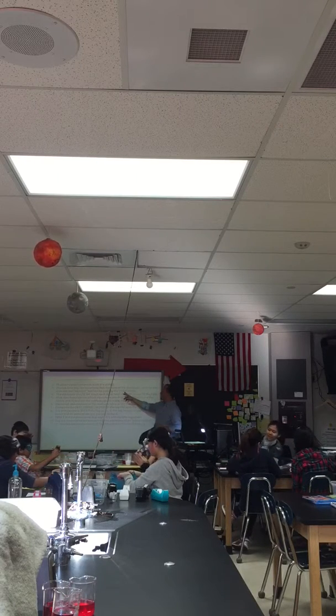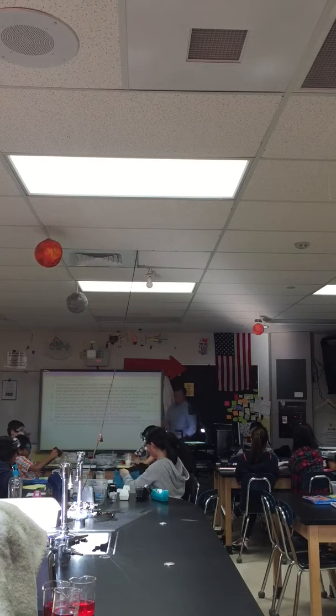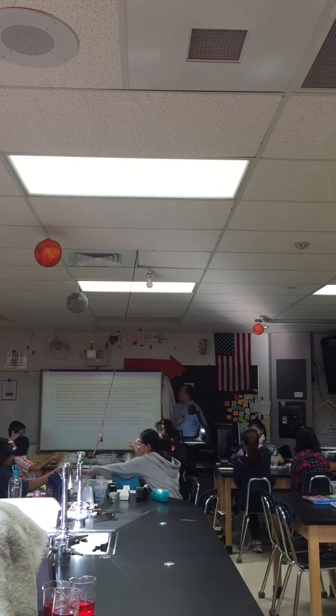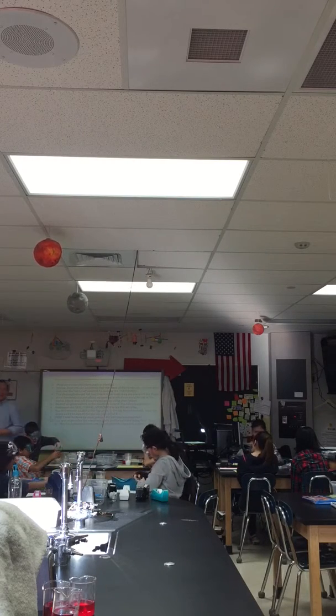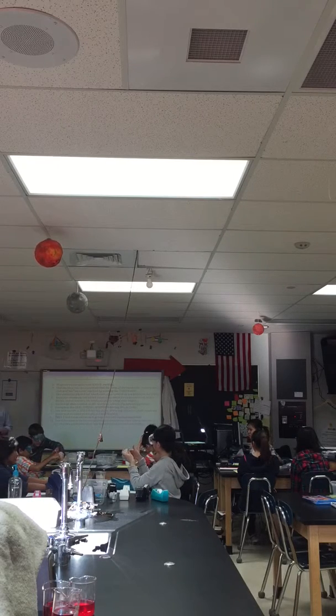Number 3, discuss how you can accurately find the mass of the chemicals. We're not using the Petri dish, we're using the extra vial that does not have the red mark on it, and the zero out method by pushing the tare button. Can somebody tell me how we're going to zero out to find just the mass of our substance? We do not want the mass of the vial. Explain how you're going to do that, Ashley.